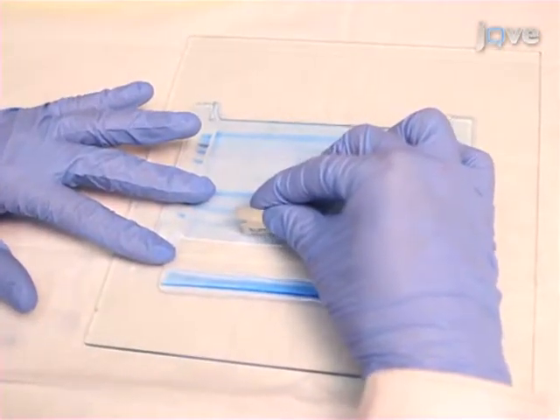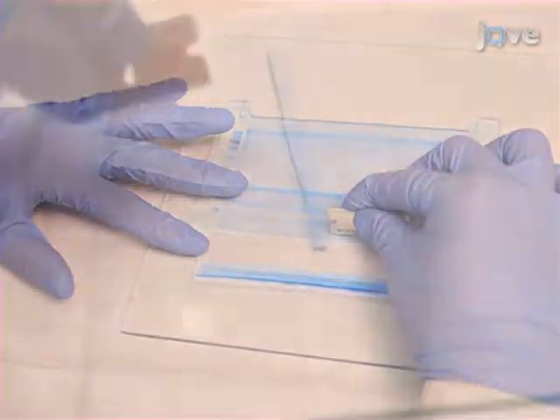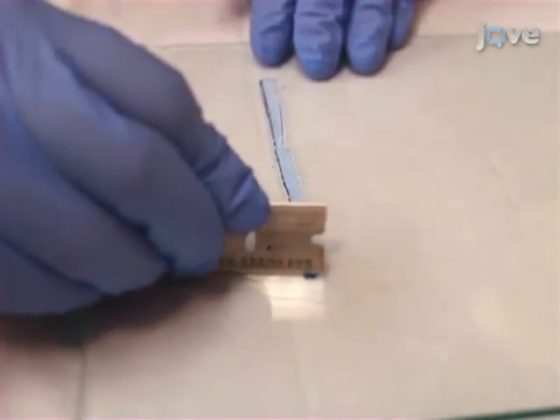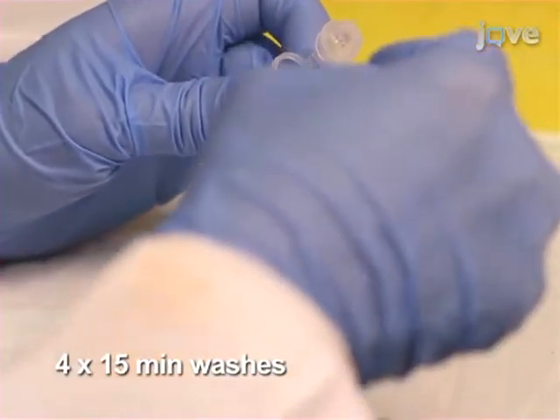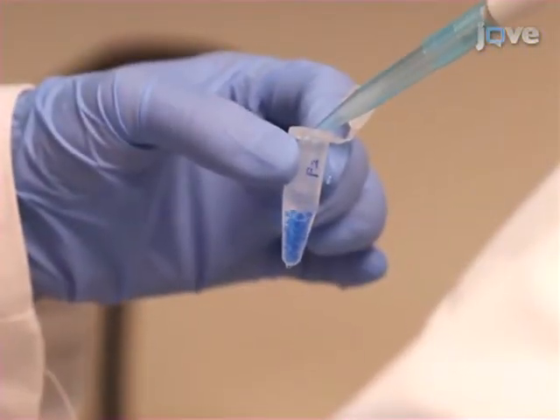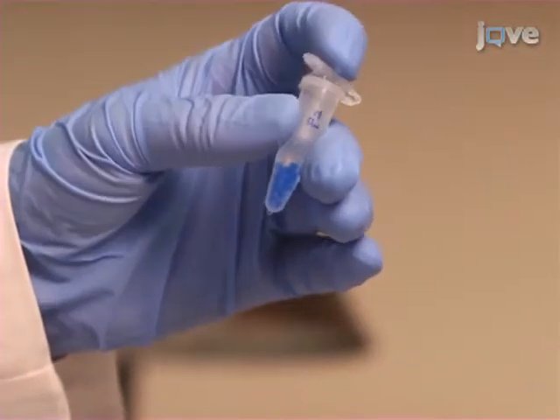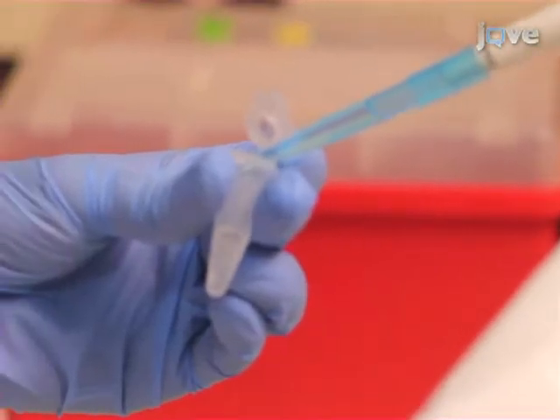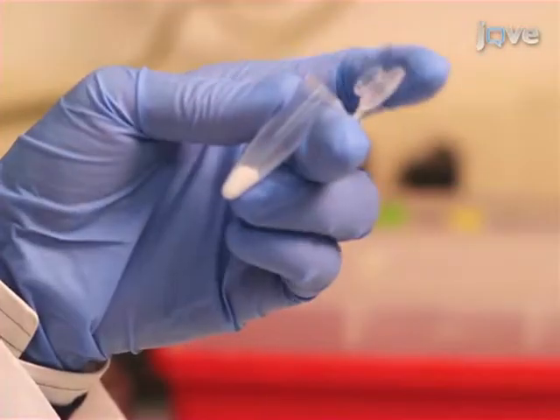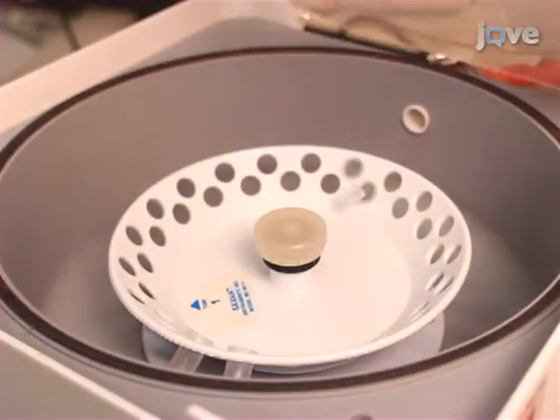Based on protein band concentrations, divide 12 fractions per gel lane. Chop each fraction into 1 mm pieces and place into a 1.5 ml tube. Completely destain the gel pieces with 0.1 molar ammonium bicarbonate in 50% acetonitrile. Now cover the pieces with 100% acetonitrile for 15 minutes, remove the liquid and dry the pieces using a speed vac.